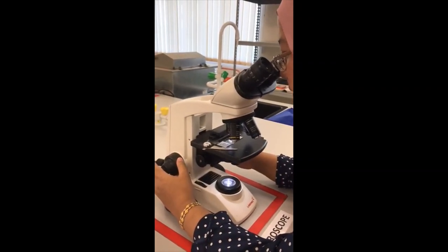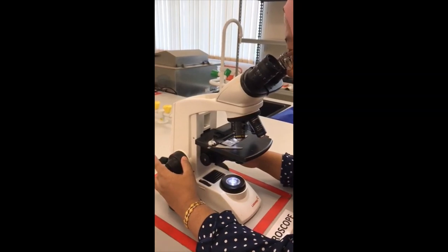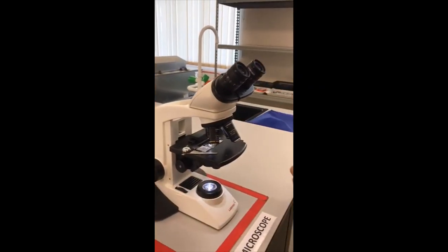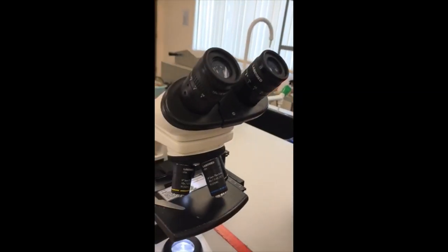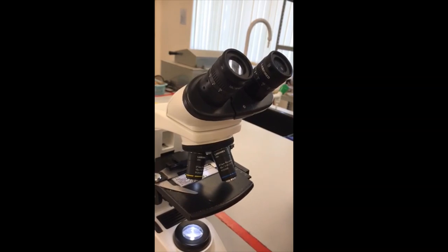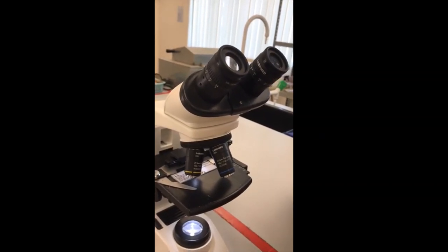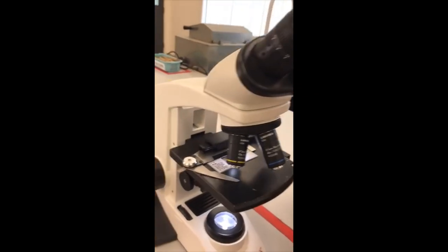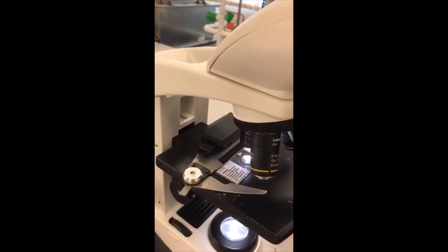I've managed to locate my specimen. Normally, to locate my specimen I will use the lowest objective lens, which is 4x. But for today's study, I want to observe the stages of mitosis in the Allium species using the 40x objective lens.